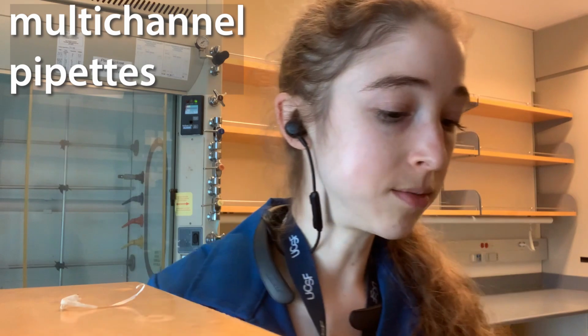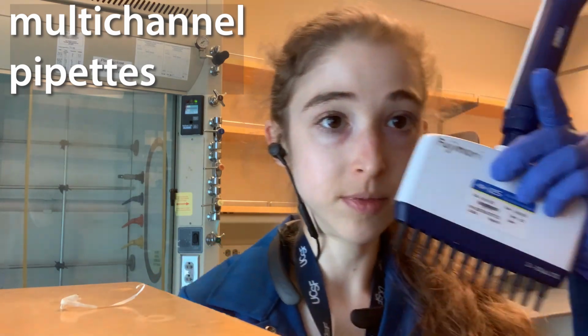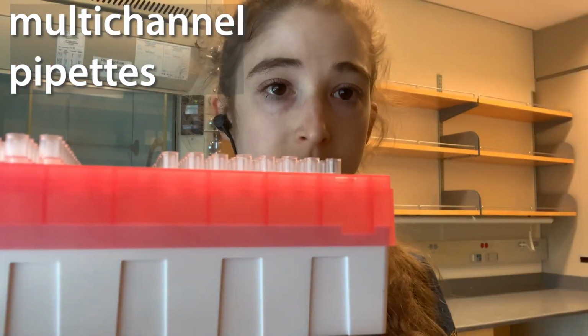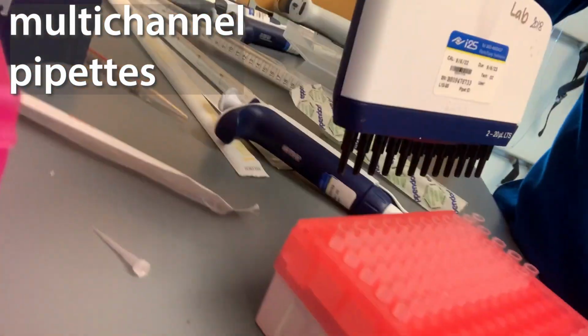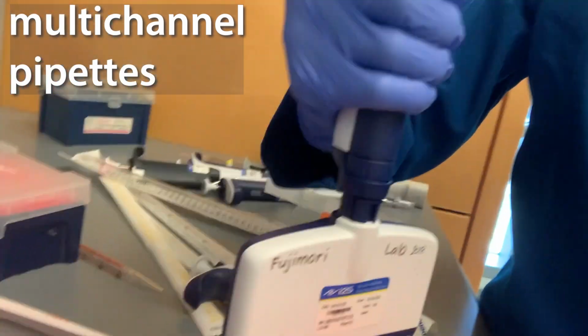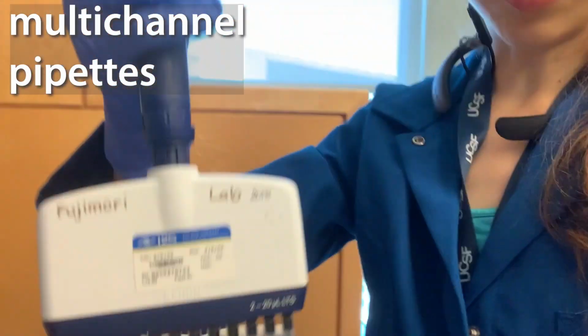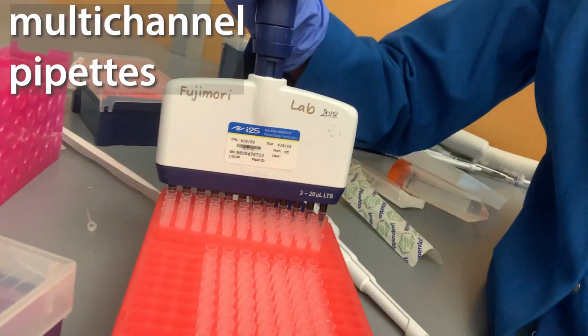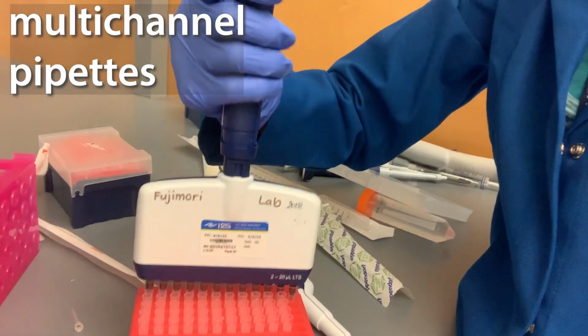When it comes to working with the multi-channel, there's another thing to keep in mind. When you're grabbing your pipette tips, you want to make sure that you're evenly distributing between the different edges. Sometimes it's easy to get it wrong, especially if you're doing it at an angle. What happens is that when you draw it, it'll be partially in on some sides and not all the way. This is going to make it so that either they're not all stuck on, or you're going to have some of them that have more volume than other ones, and none of those things are good.